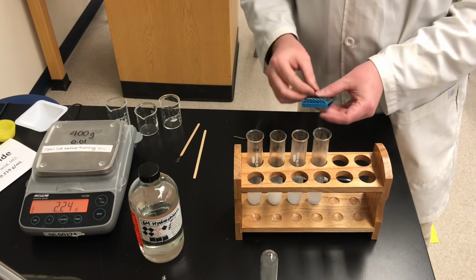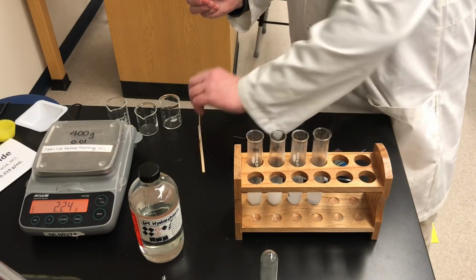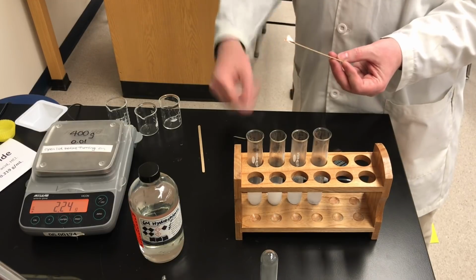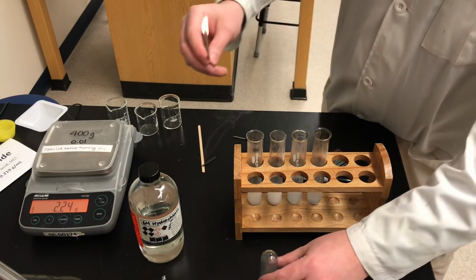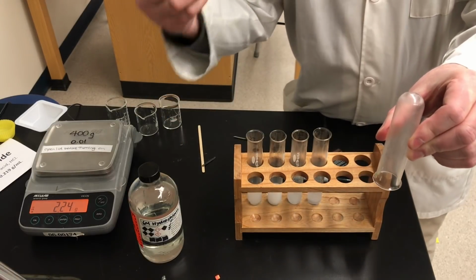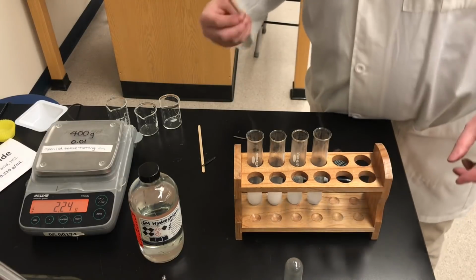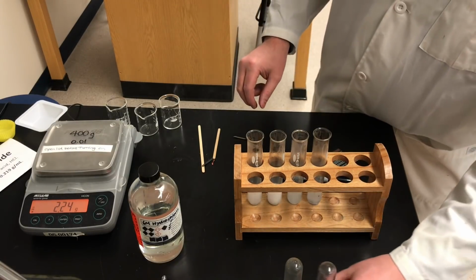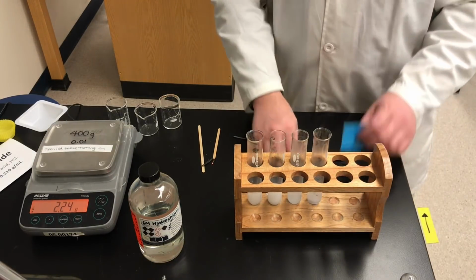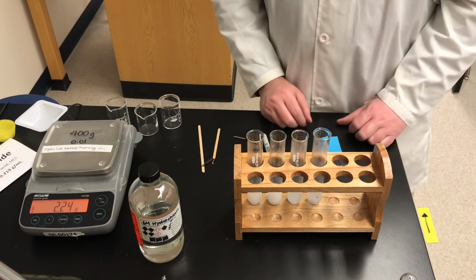So a burning wooden splint is being put into the mouth of a test tube full of gas, and you heard and saw a characteristic popping explosion. So one more time. That one was not very impressive. There was a bit of flame there, but not that popping sound. In any case, that should give you evidence of the gas that's being produced, its identity. Grade 11 students, you would have predicted the identity already, but that test confirmed it.